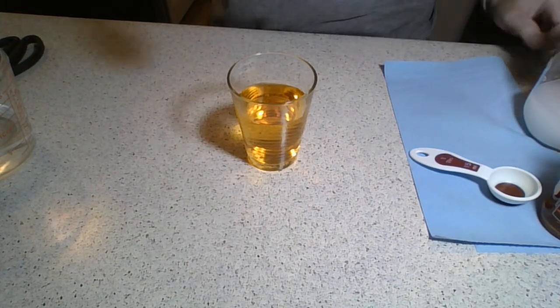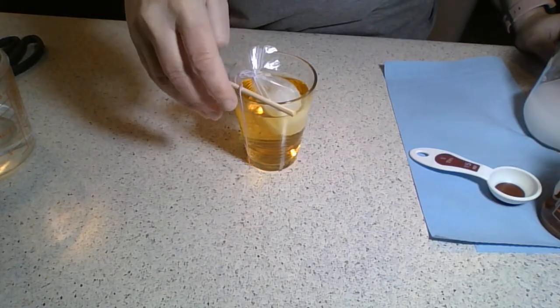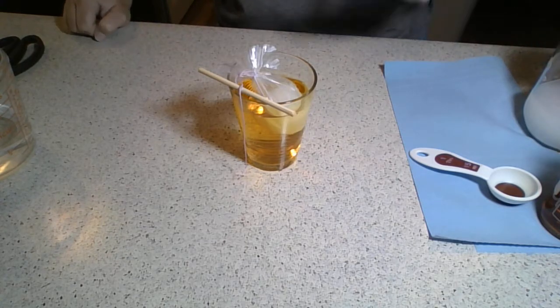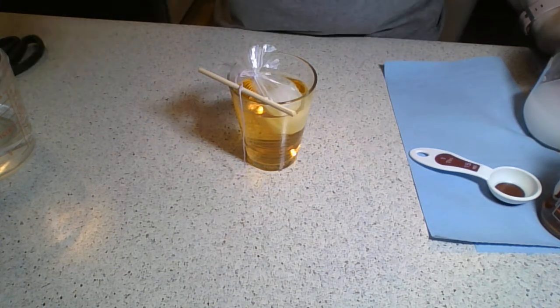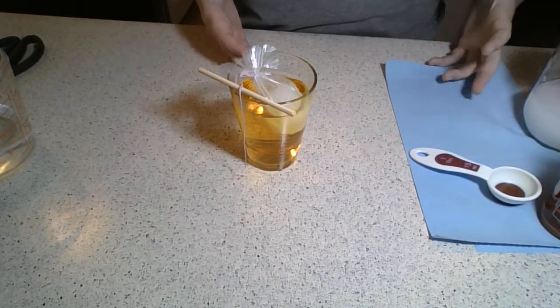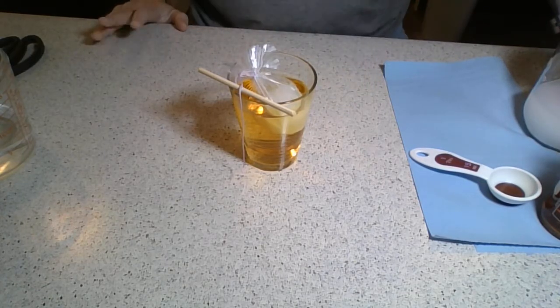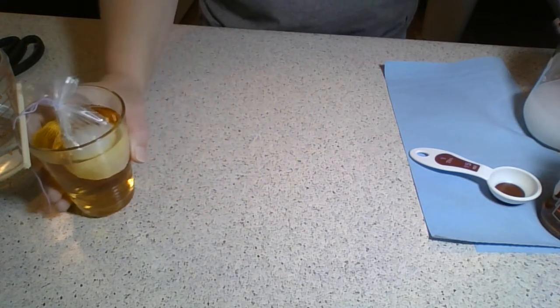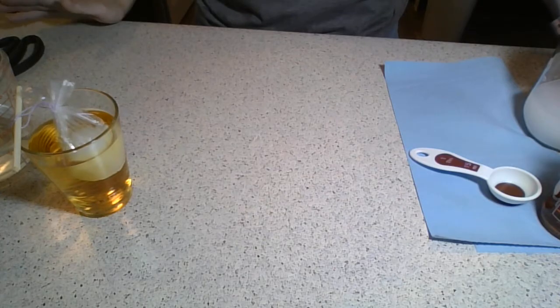I'm going to take my cell and place it into my iodine solution. This one is going to float, it looks like, and I'm going to leave it sit here. Depending on the type of bag you use — I just used a sandwich bag — it may take longer or less time. You're going to watch it. Anywhere from about 25 minutes onward is my experience with when you start to see results. We're going to watch for any changes either in the liquid or in our cell. I did this previously and it took about 25 minutes, but we can't have a video that long.